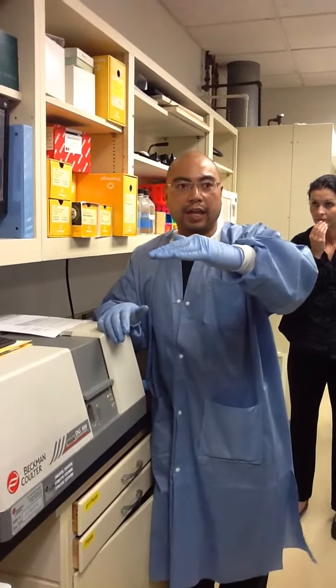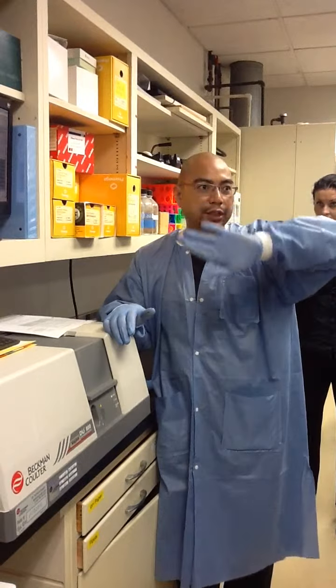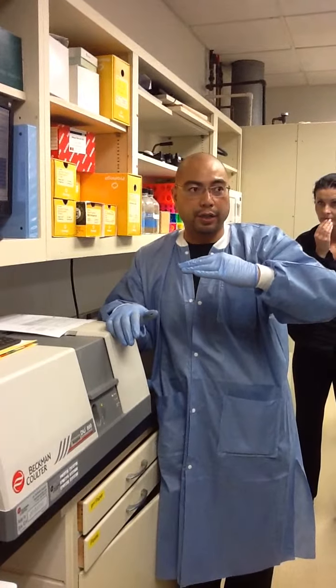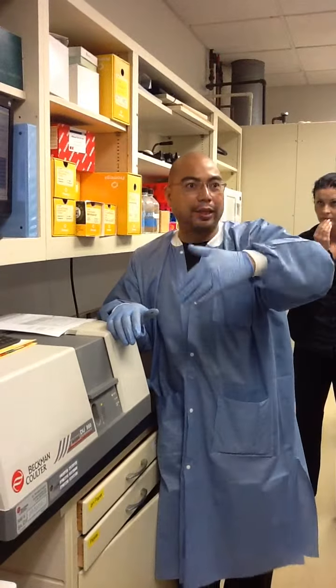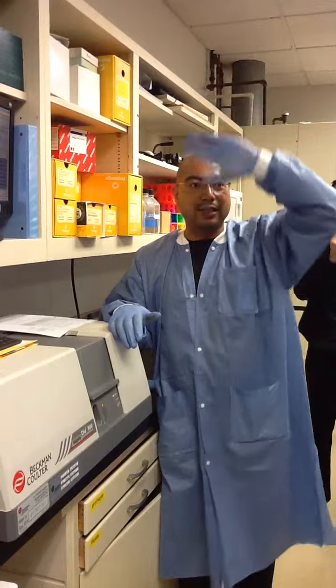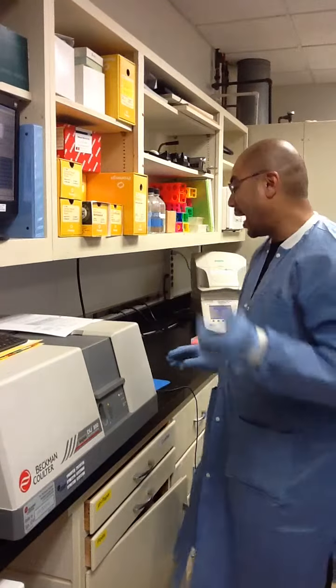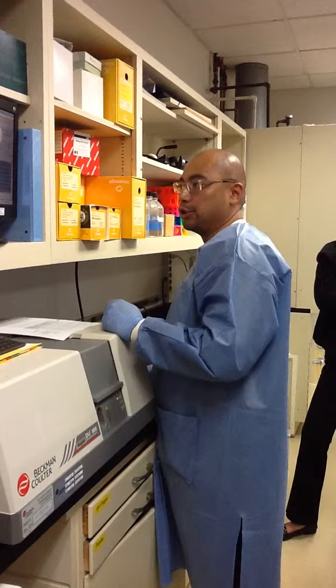You're going to see nothing, and then at 82 degrees, everything will denature based on the ATGC melting calculation. That'll be the indication that there's a single band there. And then maybe another one at 87 degrees. It's a neat way to analyze the data in terms of the melting curve, and we'll talk a little more about how that can be useful.